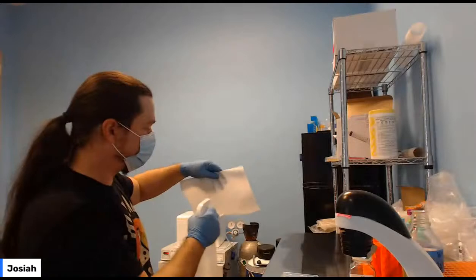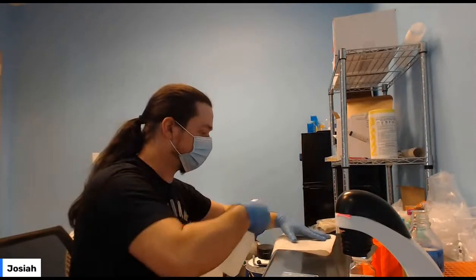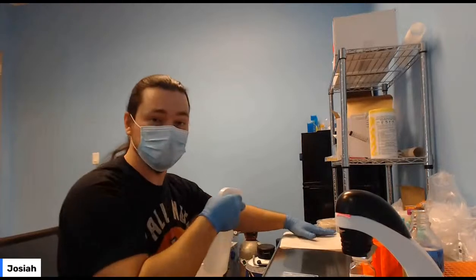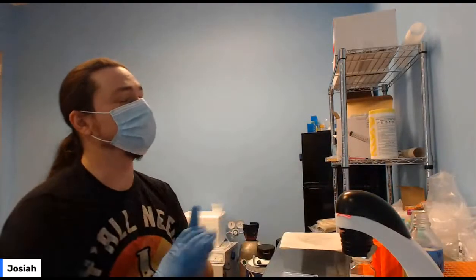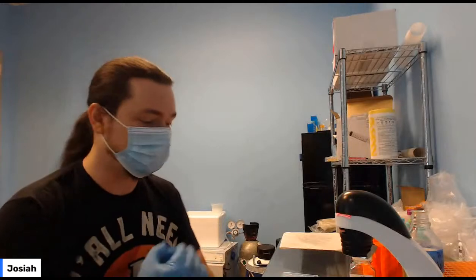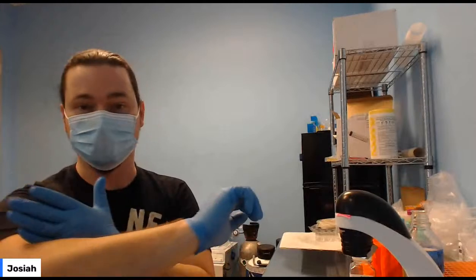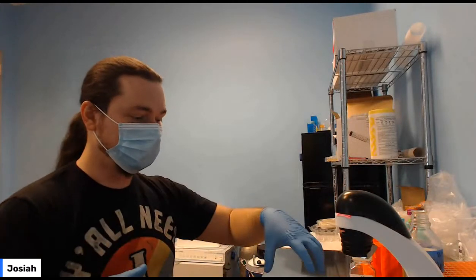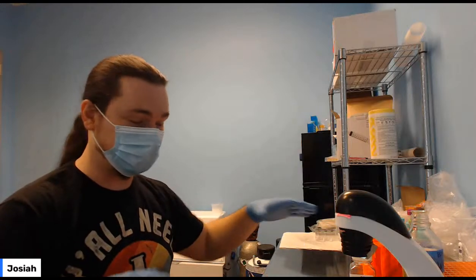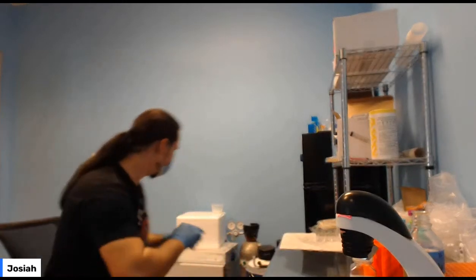I'm sure a lot of you guys got contamination. It's a skill. It takes practice, and there's a lot of stuff that you have to do to get to where you get less contamination. But there's a few easy things to remember. One, clean all the surfaces. Wear gloves. Wear masks. Clean your hands all the way up to your forearms with alcohol. Just try to be as clean as possible. Don't take the lid off and set it down and then just leave it exposed to the air. Things like that help a lot.